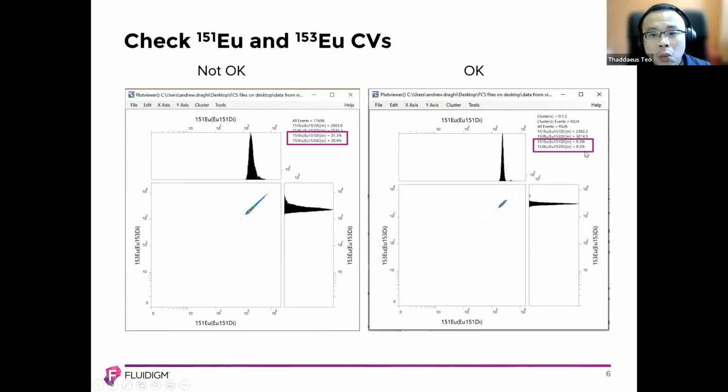Why do you have this in the end? It's not okay. It's most probably due to the cones being dirty, resulting in a broader CV. So if you see this, do try to clean your cones before you rerun the whole thing. When you clean the cones, remember it's both skimmer and reducer, and this can help you to tighten the CV thereafter.